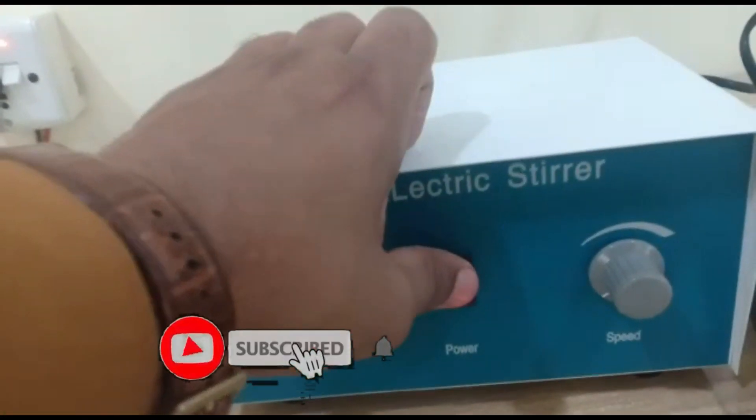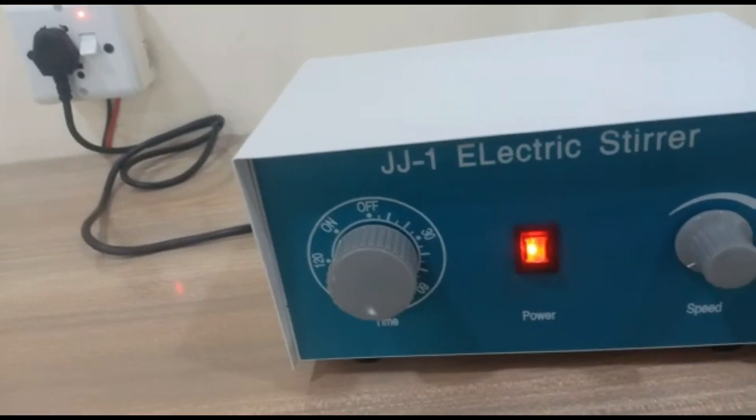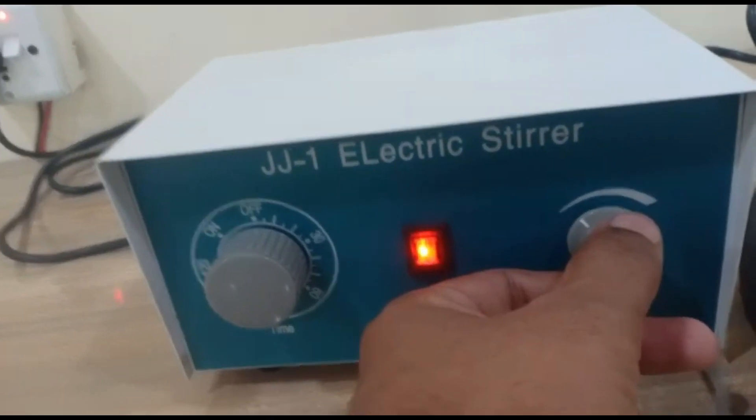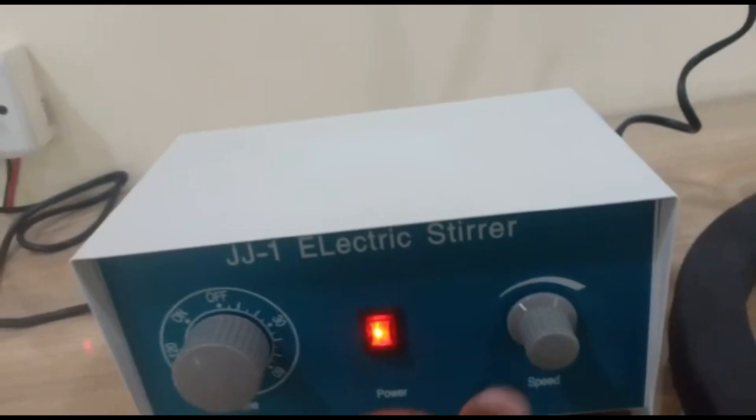So here, we have to plug it in first. And here, we have the on and off switch. Now, we turn it on. And here, we can adjust the speed.